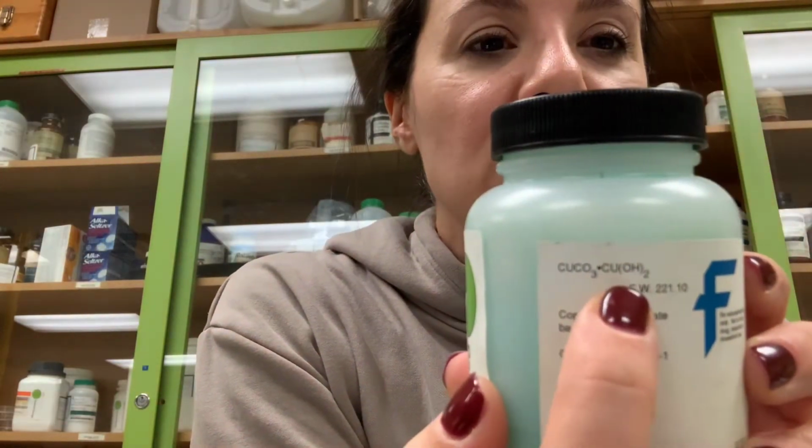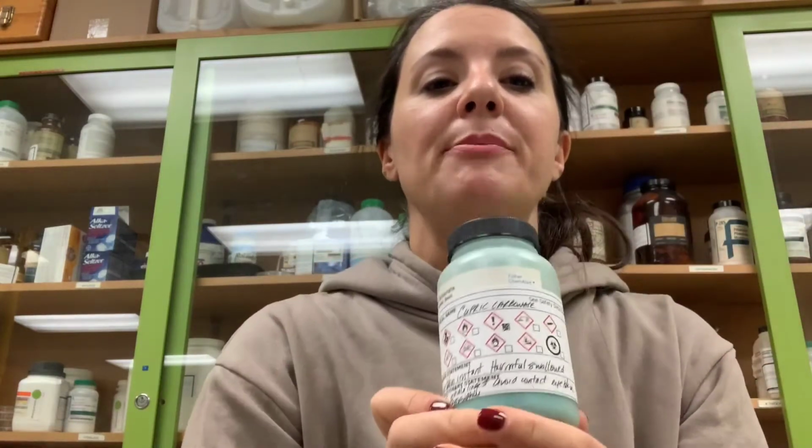What we're going to do is take this chemical here, called copper 2 carbonate, basic. Now in this formula there is an OH group, so don't let that fool you. This compound will decompose into carbon dioxide, water, and copper 2 oxide. The carbon dioxide and the water are going to dissipate because they are gases, and we'll be left with just the solid product, copper 2 oxide, in the end.